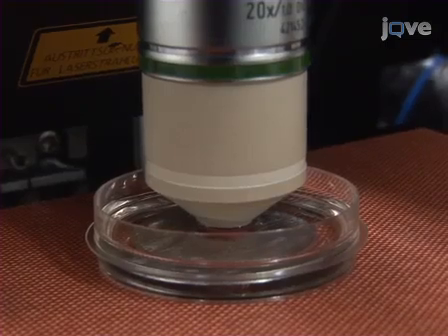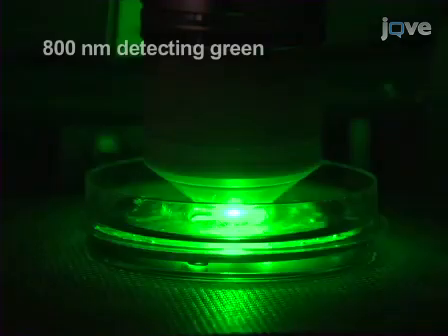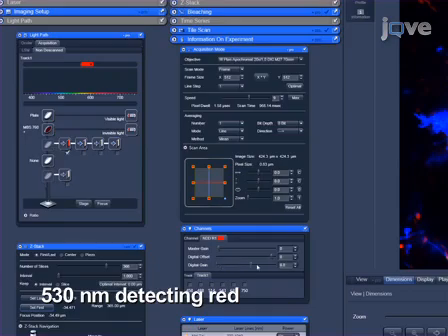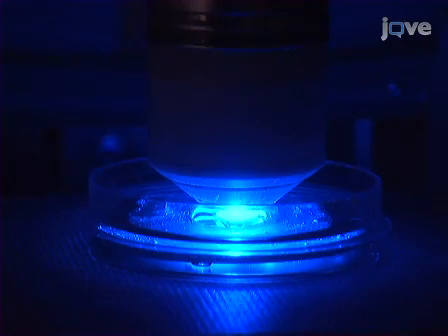For imaging, different areas along the dissection are scanned down to 400 micrometer depth using an illumination wavelength of 800 nanometers, detecting green, 530 nanometers, and red, 580 nanometers fluorescence, as well as the second harmonic generation, or SHG signal, and the blue Calcofluor fluorescence at 400 to 470 nanometers emission with external non-descanned detectors, or NDD.